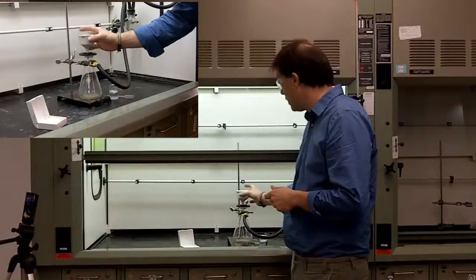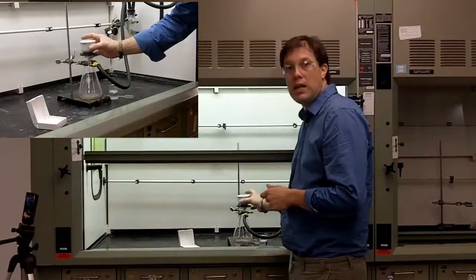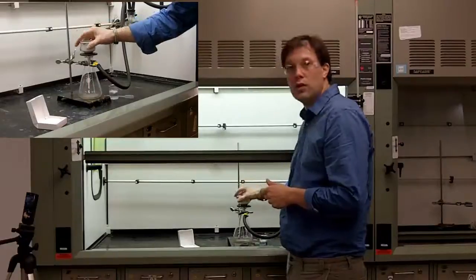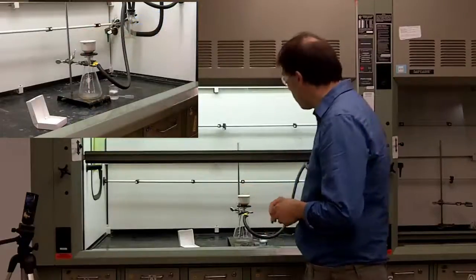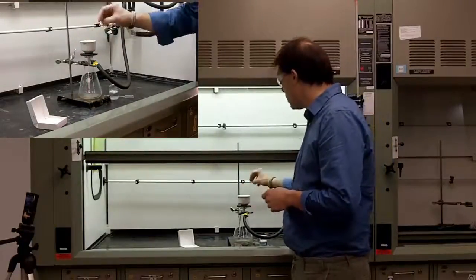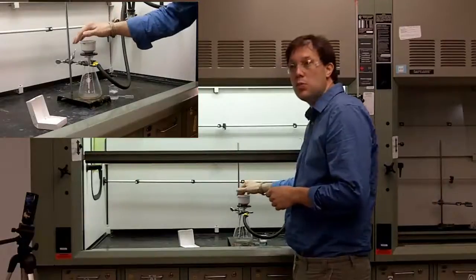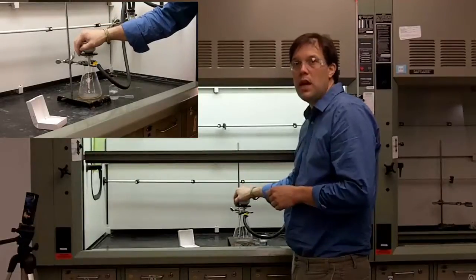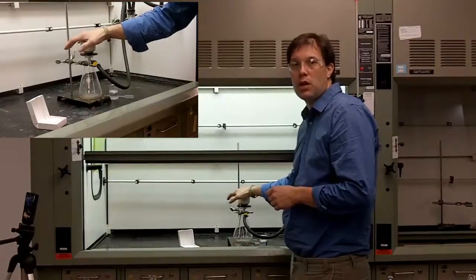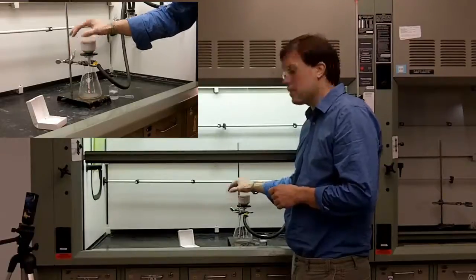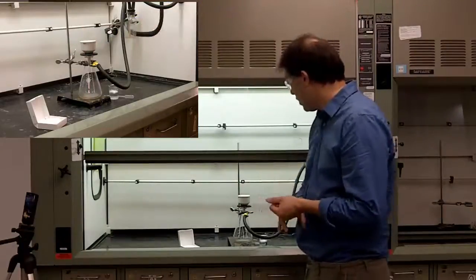And you're going to start hearing air being pulled. Now at this point, many students think you should not be able to lift this up, but you can easily because air is still going through the funnel. If you really want to check whether or not the vacuum is pulling well, just put your hand over the top a little bit, and you'll start to feel the vacuum pulling on your hand in a suction manner, and you'll know that it's working well.